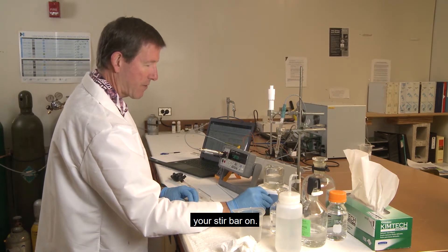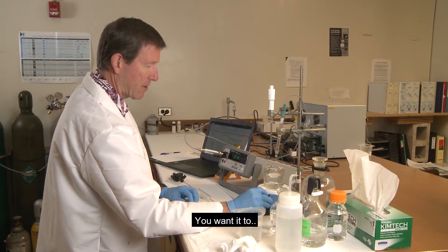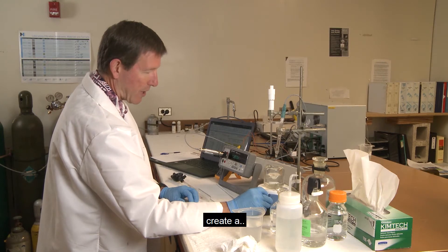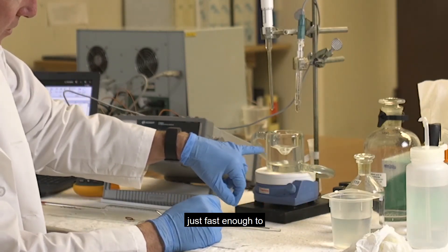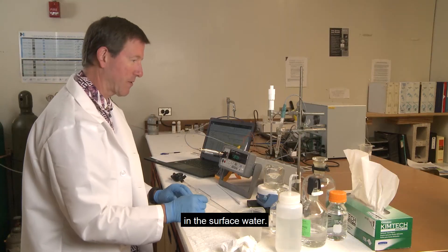Now you can turn your stir bar on. You want it to create a, turn it on so it's just fast enough to create this little dip in the surface water.